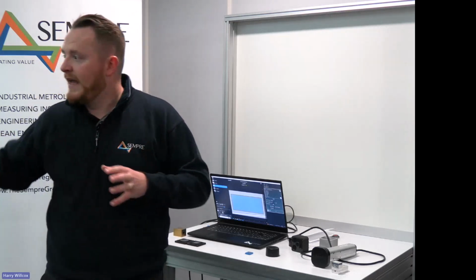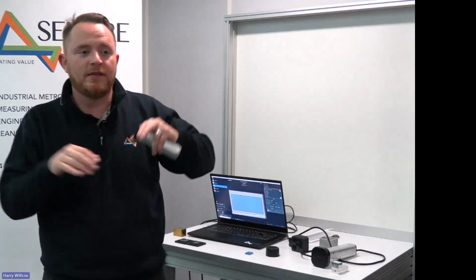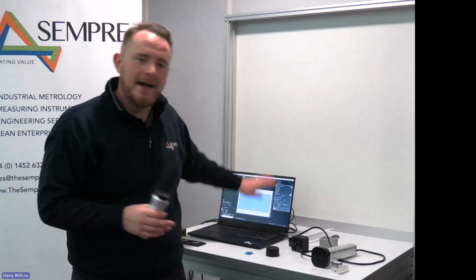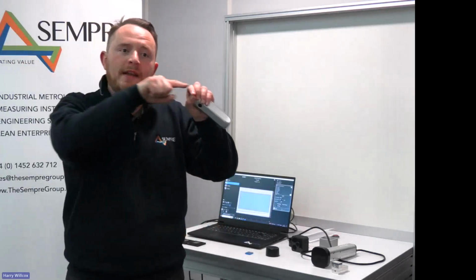So I'm happy, again, for the specific question, if you pop me over some details, I can give you some indication on the differences between softwares, because there's different costs associated to if you were to look at the Pro package, which is what I've been demonstrating here, and what they call the Core package, which is where you've got the step height or offset changes and the scratch functionality. So you wouldn't have your defect detection or your roughnesses.